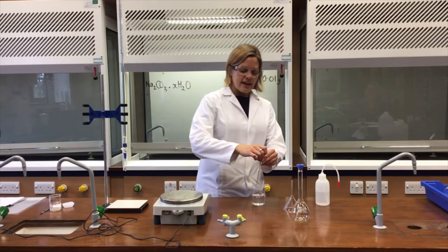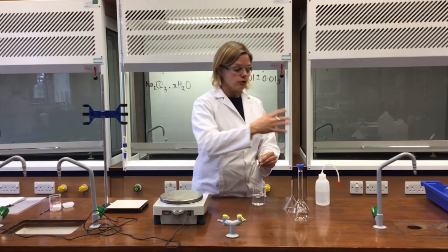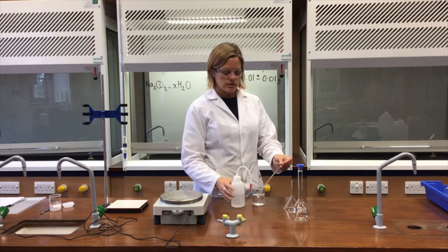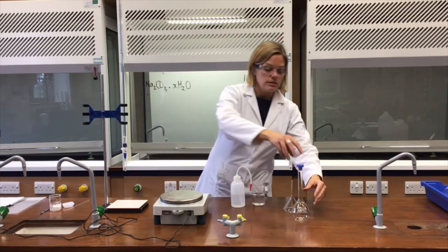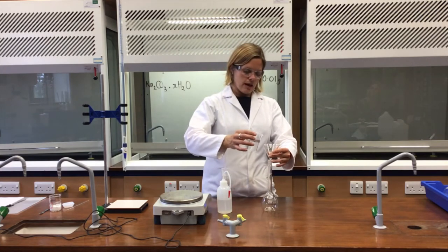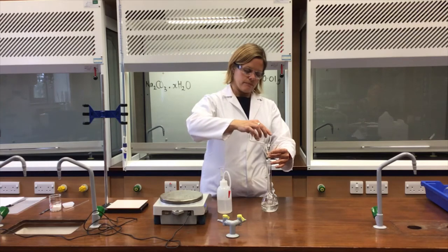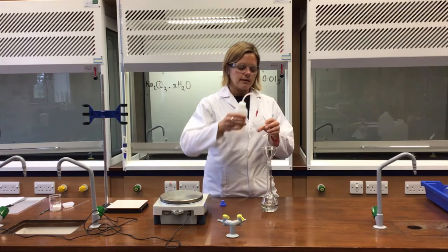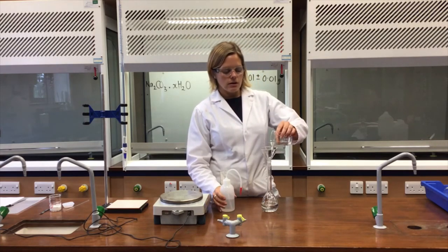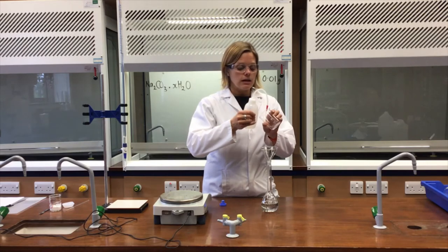Now that all the solid has dissolved, the aim is to make sure every single mole of solid ends up in the volumetric flask, so I need to be careful. First, I rinse the stirring rod into the beaker so any solution stuck to it is washed in. Then I take the top off the volumetric flask, hold the funnel slightly raised to prevent an airlock, and carefully pour the solution in. The key phrase for this process is: transfer the solution with rinsings into the volumetric flask.